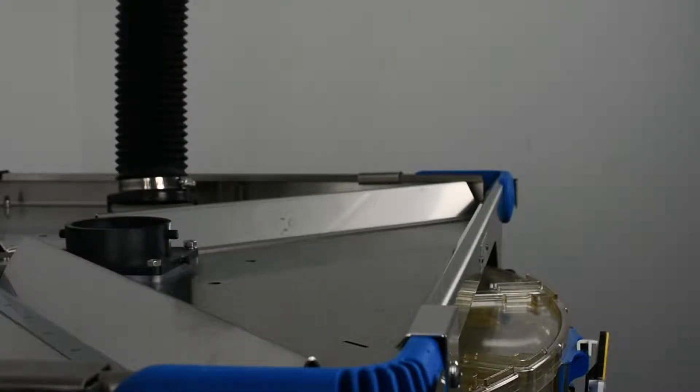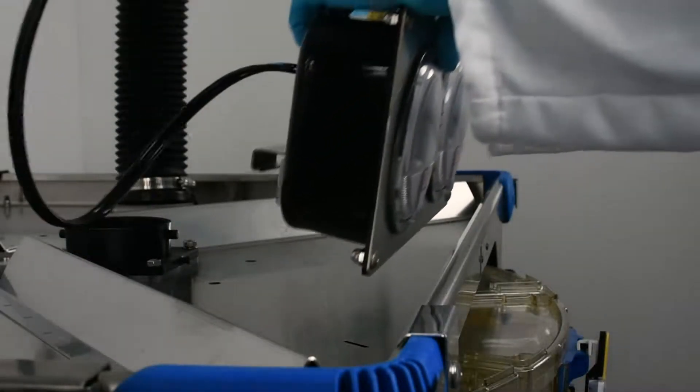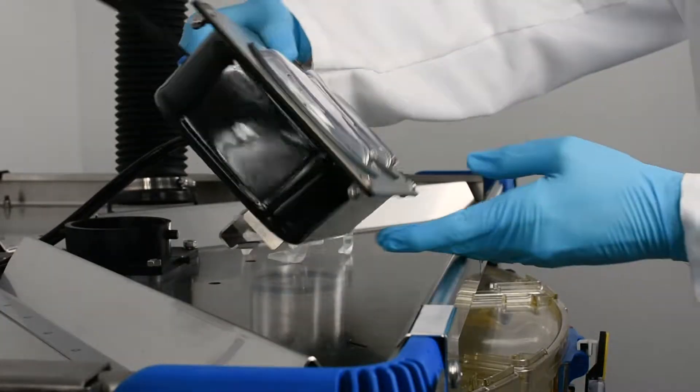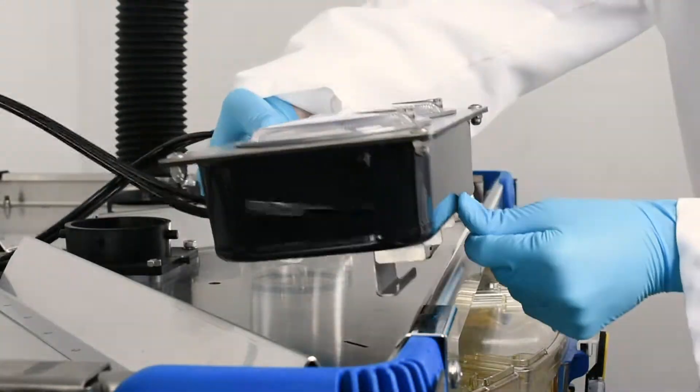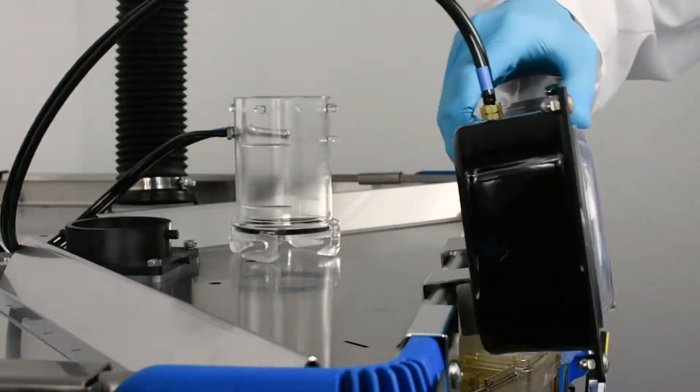Use a ladder to access the top of the rack. Angle the rack status monitor housing so the hook on the mounting bracket latches on the rack's lip. Pivot the housing downward to secure it.